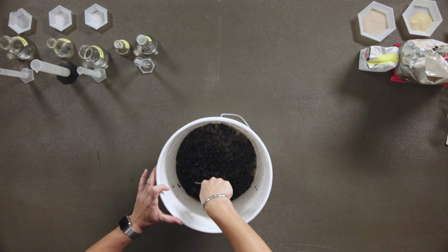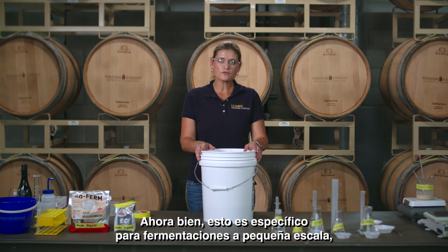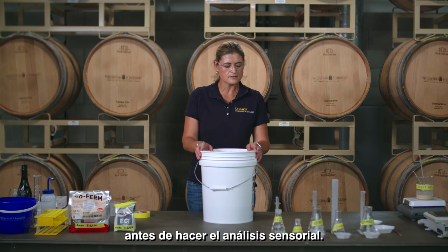Okay, now that we've made most of our standard additions, we're also going to add pectolytic enzymes. Now this is specific for our small scale fermentations, as it will help or aid extractions from the skins because it breaks down skin cell walls. It will also help you with the final clarification of your wine before you do sensory analysis.